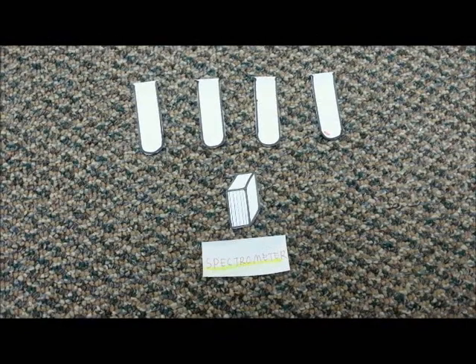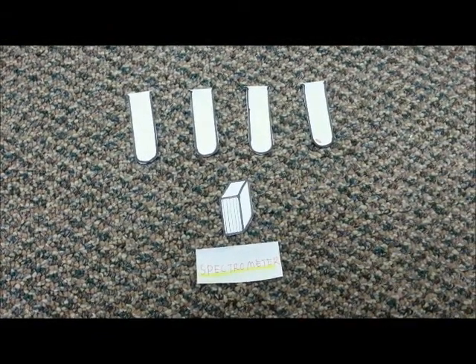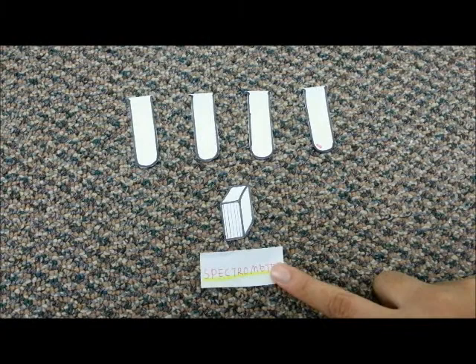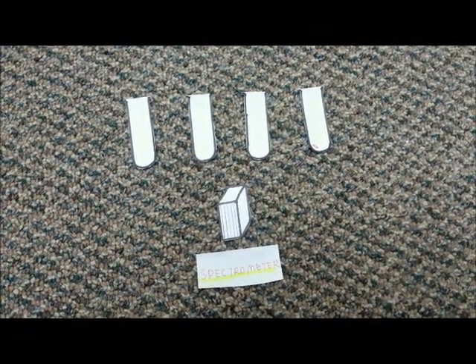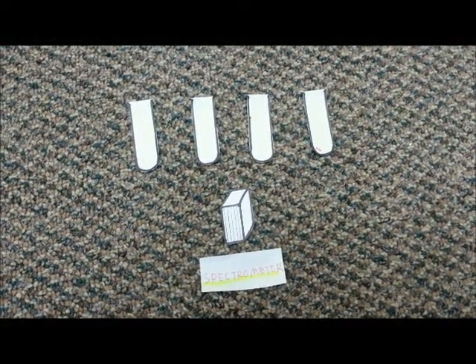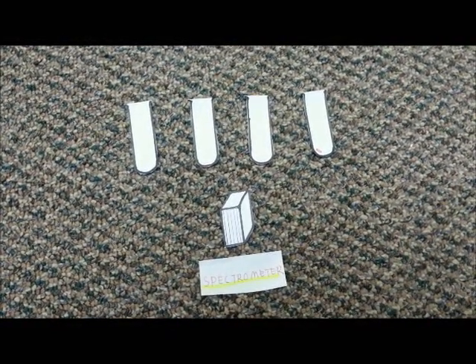Carefully transfer all the supernatant into a cuvette by using a dropper. Determine the percentage of hemolysis in each tube by measuring the absorbance of the supernatants. Set the spectrometer at a wavelength of 540 nanometers and zero it using the blank. Then, measure the absorbance of each supernatant at the same wavelength. Compare the absorbance of the test supernatants to that of the supernatant from the cells treated with distilled water.